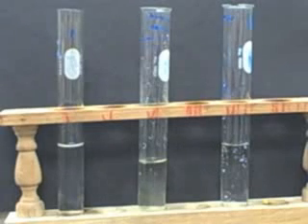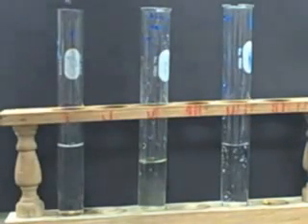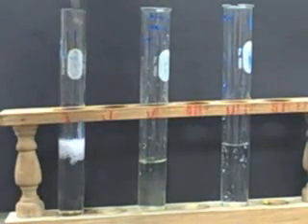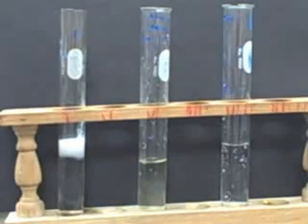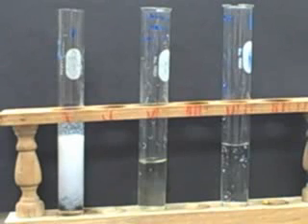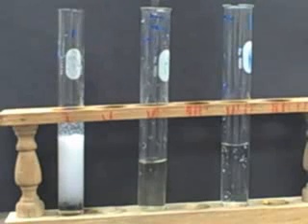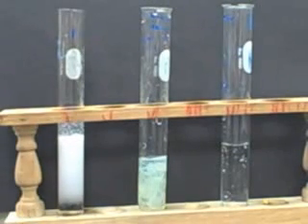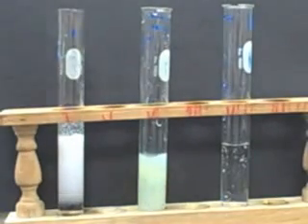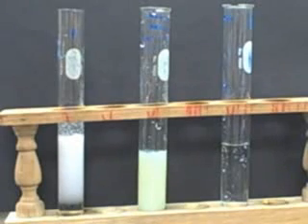So now we're doing halides, which are iodides and chlorides, or at least that's what we're doing. And so this is sodium chloride and silver nitrate added to that. You can see a nice milky white precipitate there. And then this is silver nitrate and potassium iodide, like silver iodide, which is a greenish color. Greenish yellow in color. Silver forms some weird compounds.